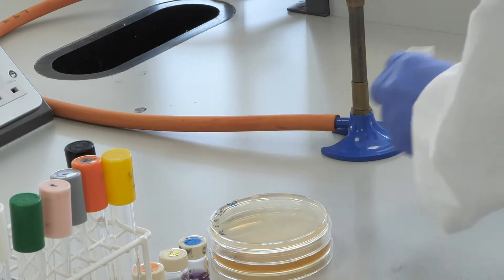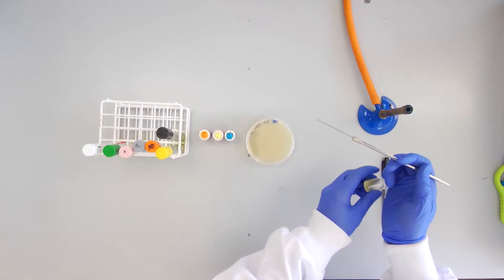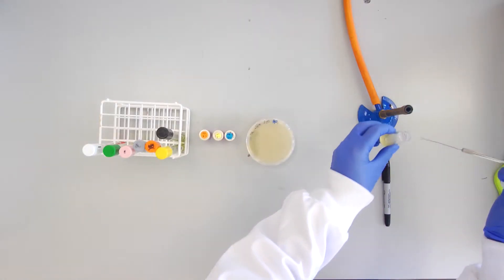For all of the liquid test tubes, add a loopful of culture to each using aseptic technique.